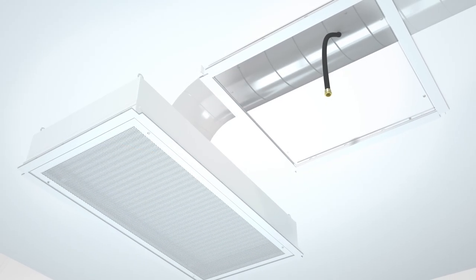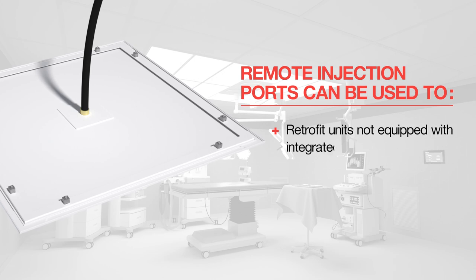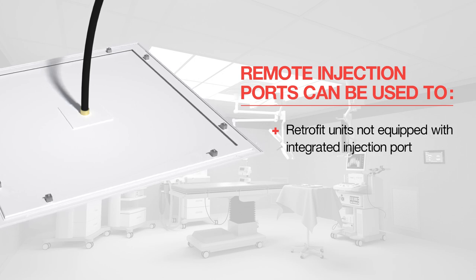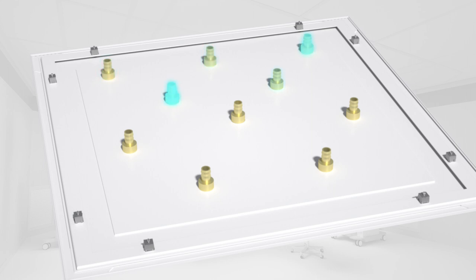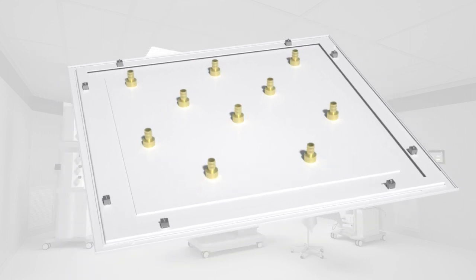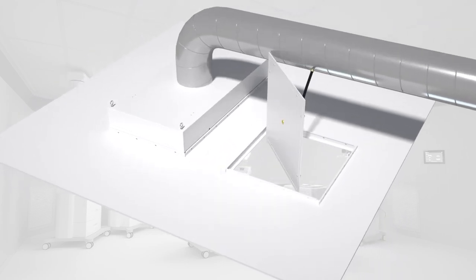If aerosol testing is required on a unit that does not have an injection port, a remote injection port can be used. Remote injection ports are used to retrofit existing units that are not equipped with an integrated injection port, or for convenience and accessibility. The remote injection port kit includes a panel with up to 10 embedded 3/8-inch female NPT ports that can be installed in either a hard lid or grid ceiling. Tubing is then run from each port and inserted into the ductwork upstream of each diffuser, thus allowing aerosol to be injected above the filter.